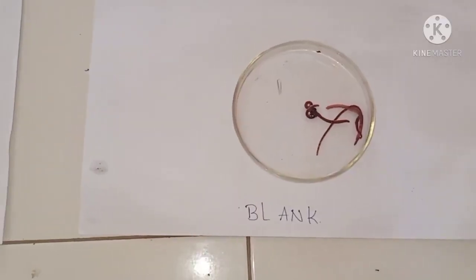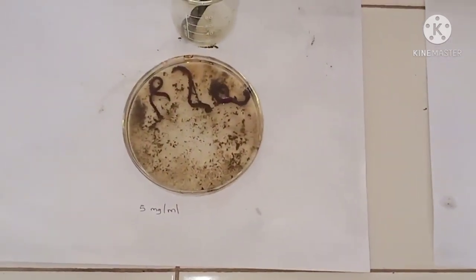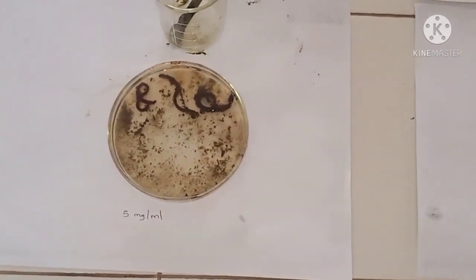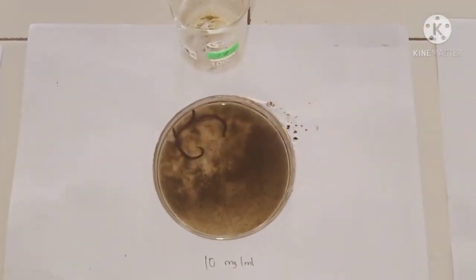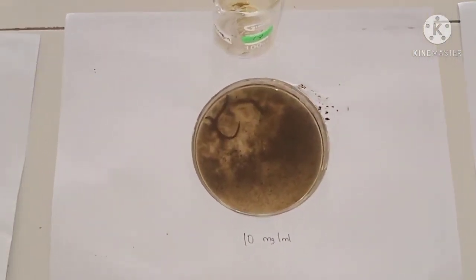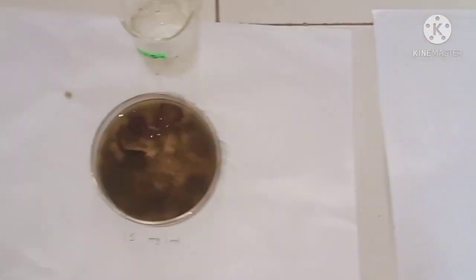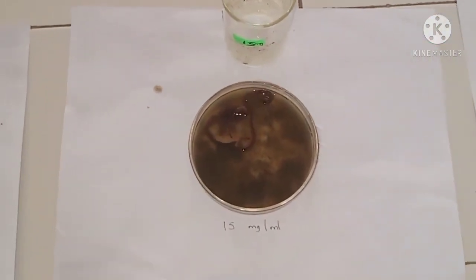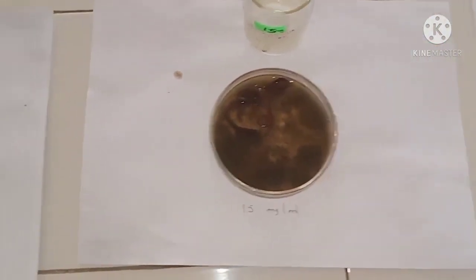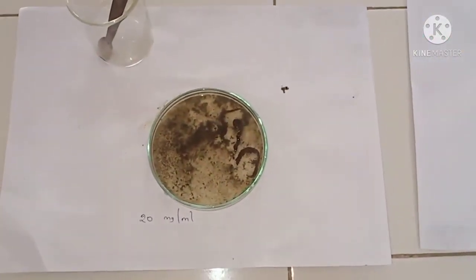This is a blank without extract. This is extract having 5 mg per ml — you can see the earthworms. This one is 10 mg per ml, here is 15 mg per ml dose, and the last one is 20 mg per ml.